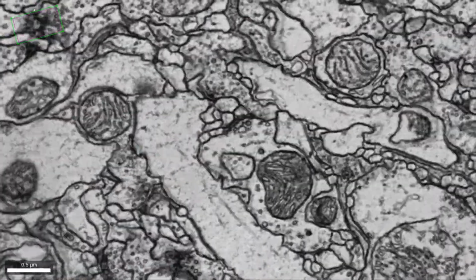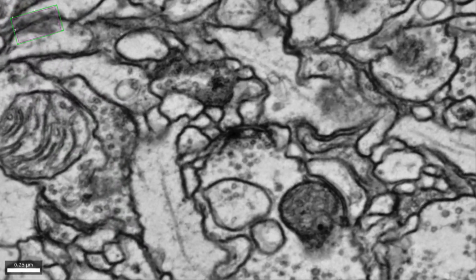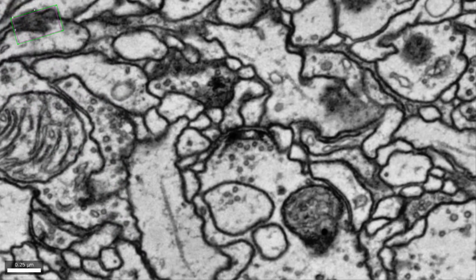But a direct method is simply to look at the underlying anatomy. What we did is image the entire brain of an adult fruit fly using an electron microscope to see these connections between neurons at incredibly high resolution. The problem is that this anatomy is at the scale of the wires in a computer chip. 100 nanometer diameter connections between the neurons, or even finer, are common. But the fly brain is almost a millimeter in extent.